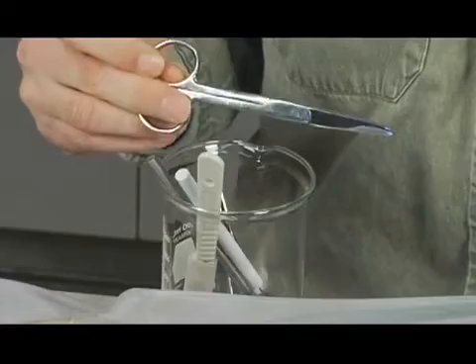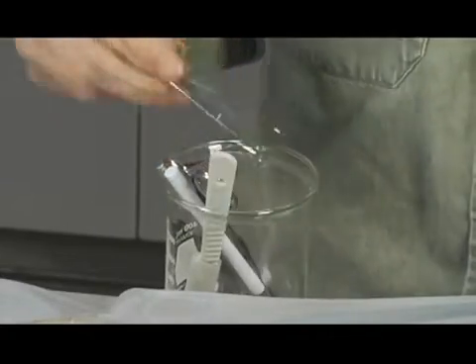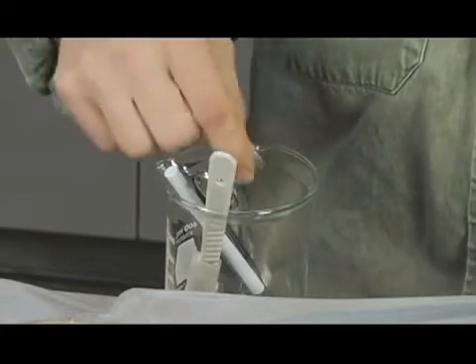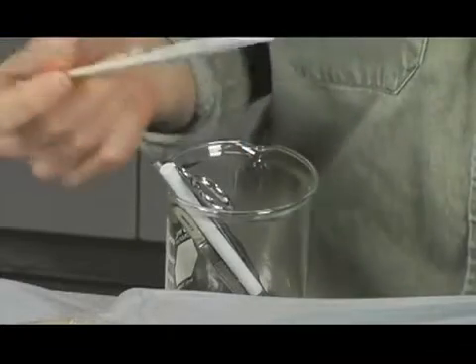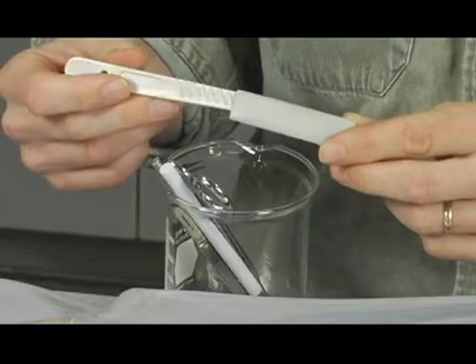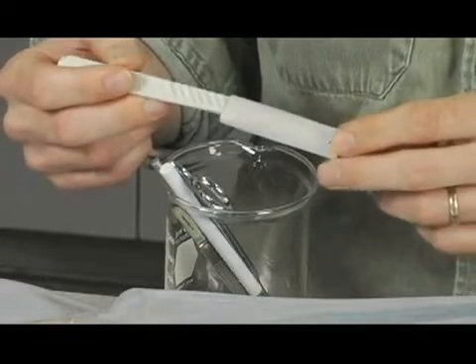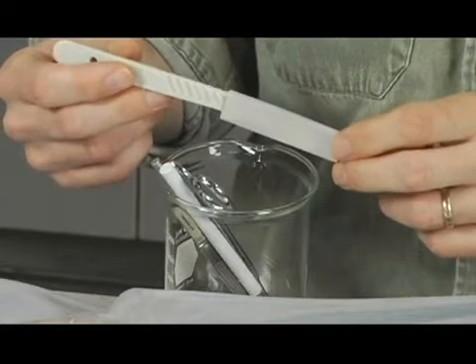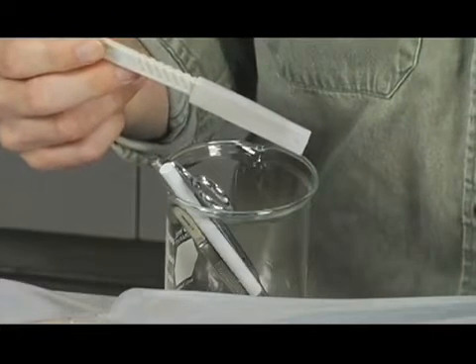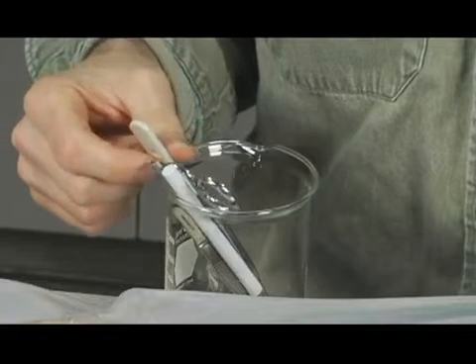Scissors, just regular scissors, something that you'd see in your house, some tweezers. And finally, we've got a scalpel. Now, I've kept the cover on the scalpel because they're very sharp, and we may or may not actually have to use this implement, but I wanted you to see it anyway and know that it is possible that we might be using this in class. I'll go over more about how each one is used as necessary when we go through the procedure.